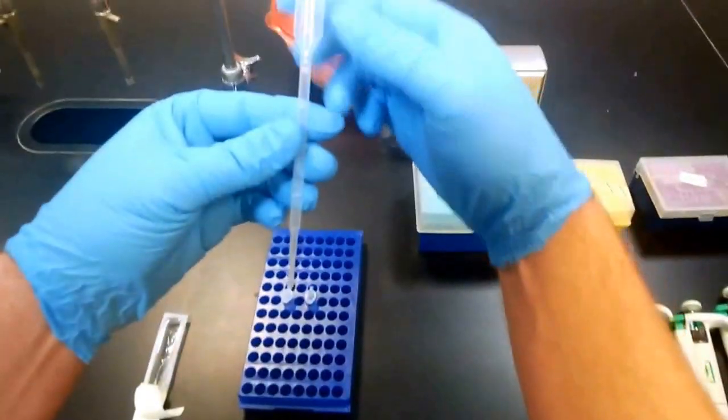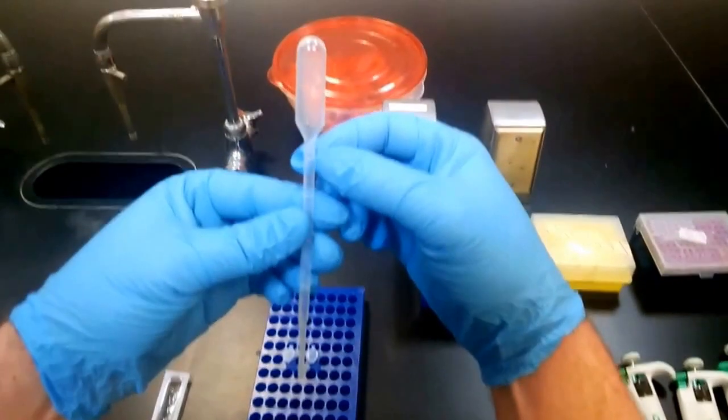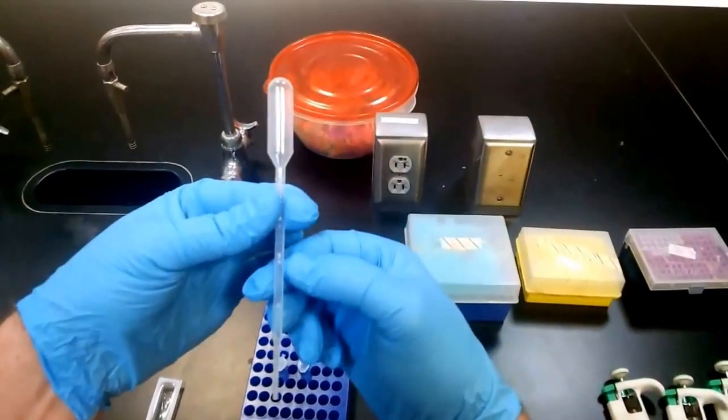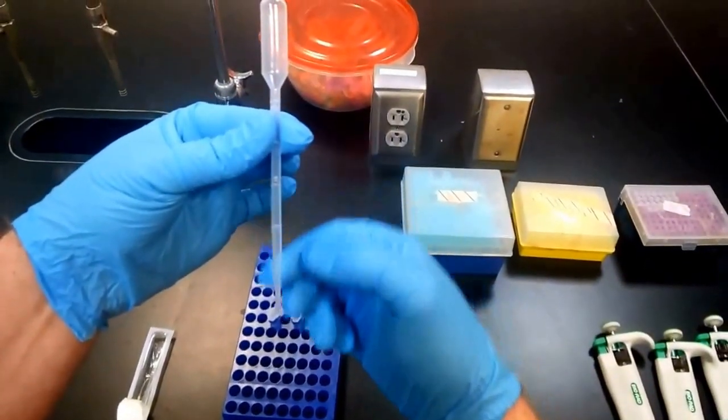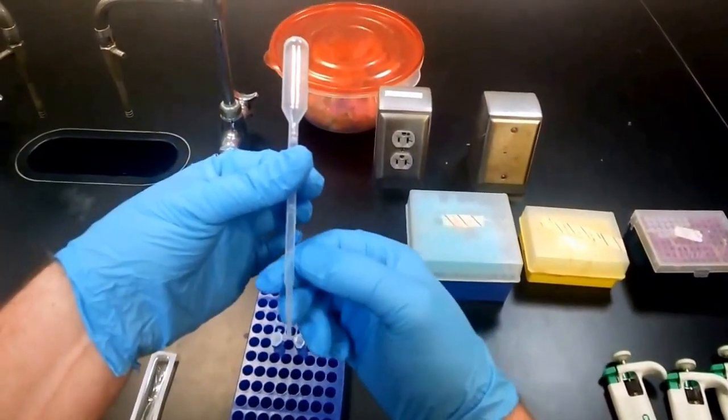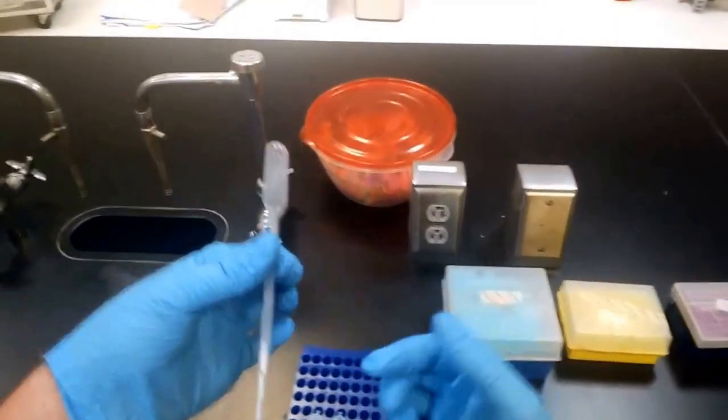So let's look at the units here. We have one milliliter, and of course half of that is 0.5 milliliters or 500 microliters. Then below that we have 250 and 100.